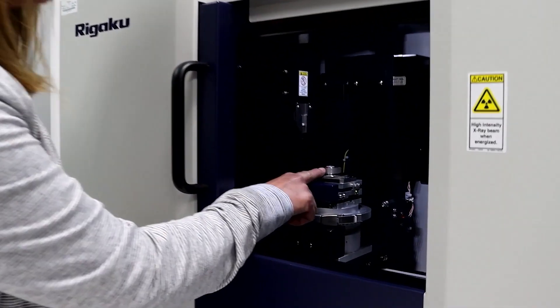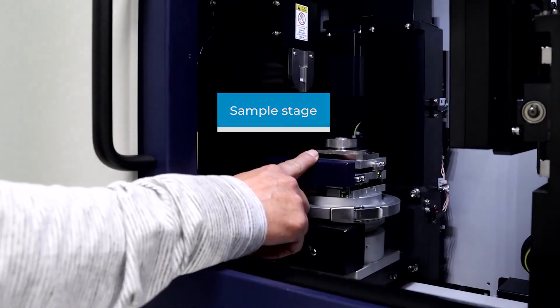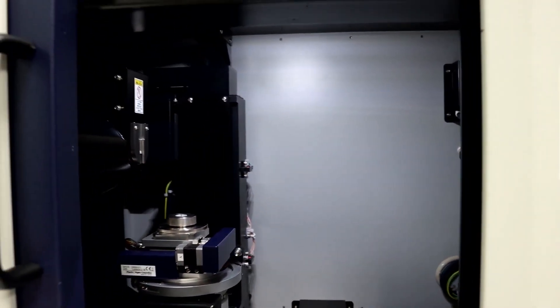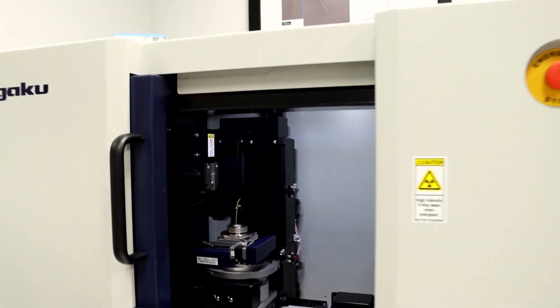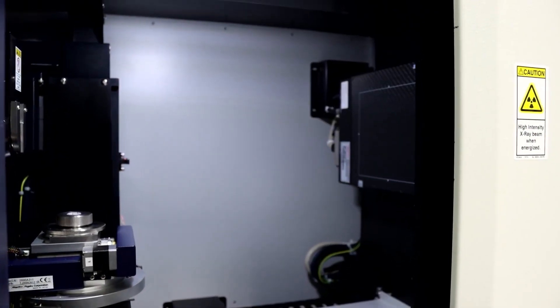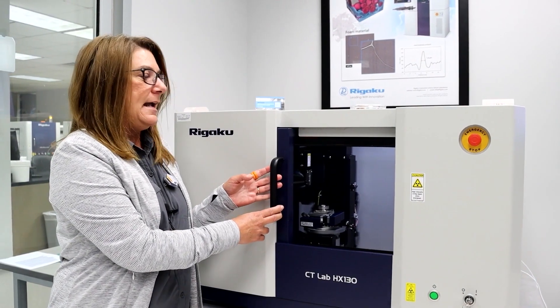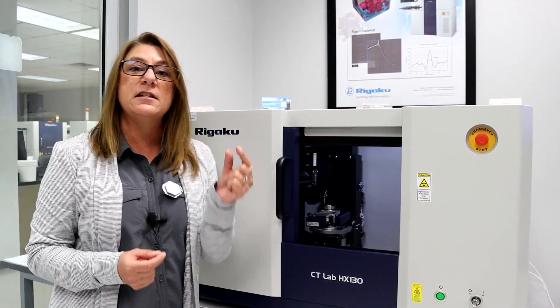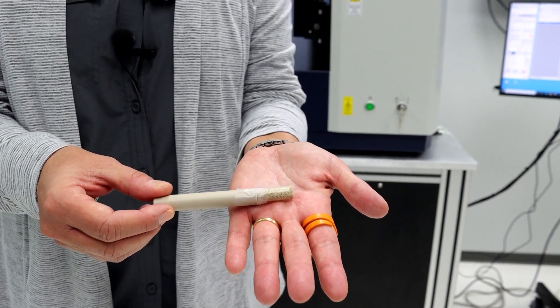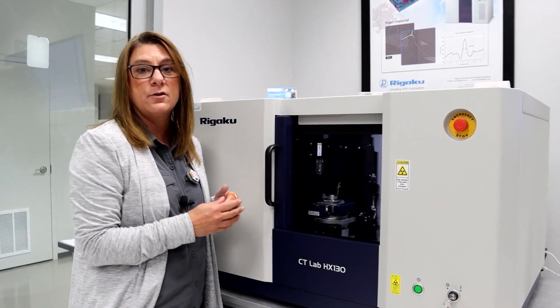This is where the sample stage is, so it has rotation and some translation. Downstream of the sample position we have the area detector, and that's where the x-ray photons will be measured. The detector is quite far away from the sample position because this is a very versatile instrument — it uses cone beam geometry. We can measure data for very small samples like this drill core, and you can measure very large samples up to 200 millimeters and still get good magnification by moving the detector far away.